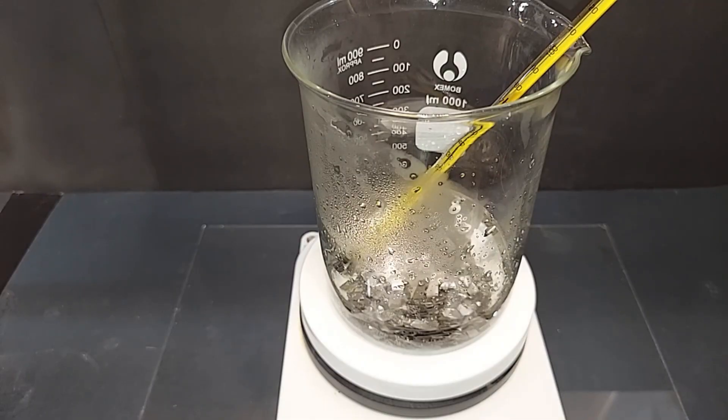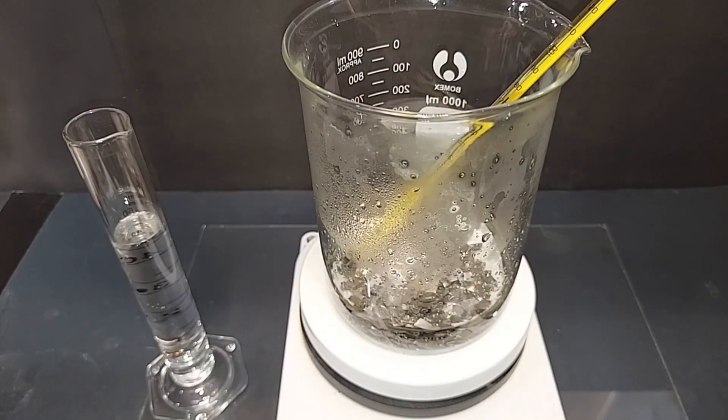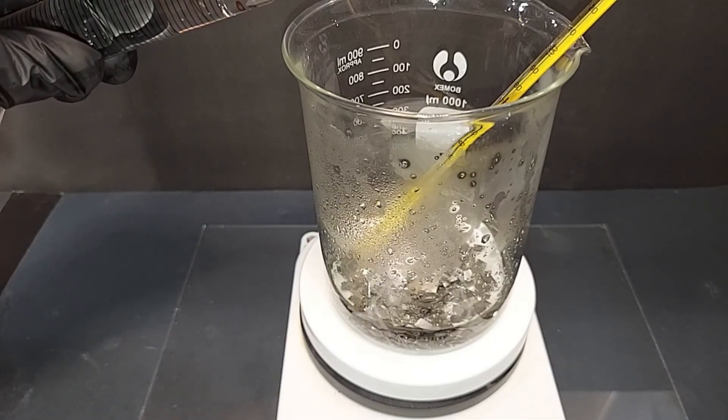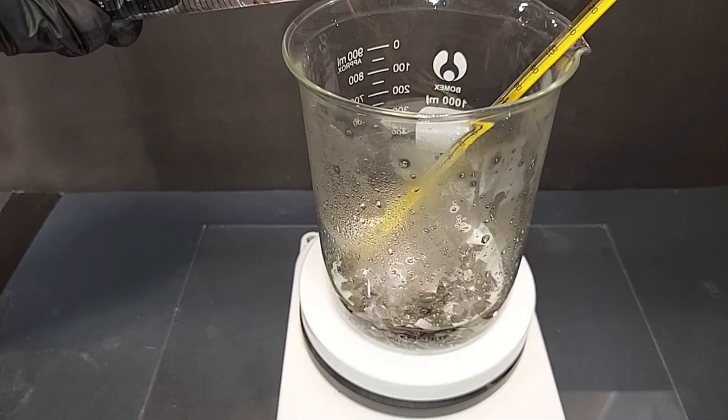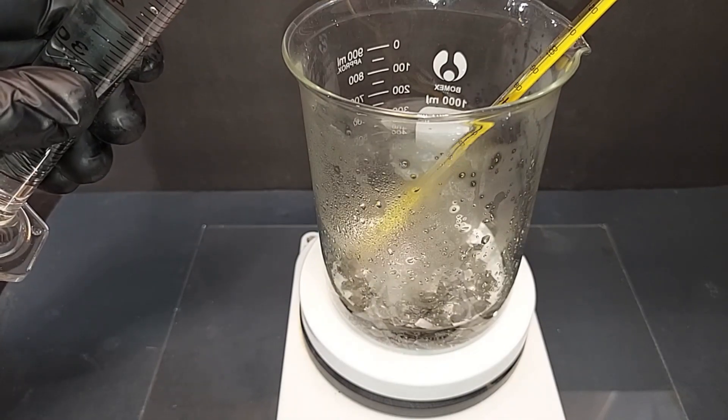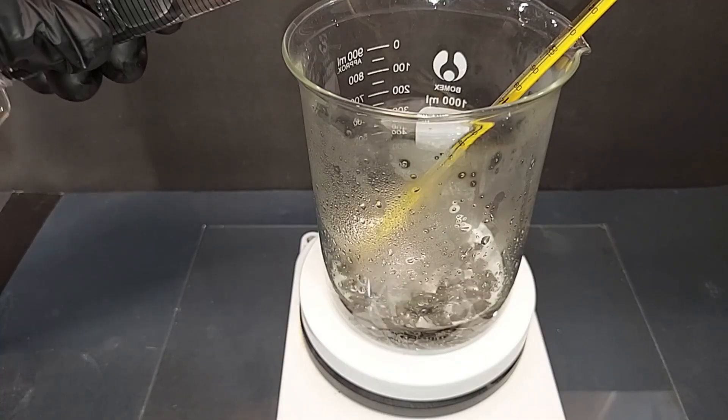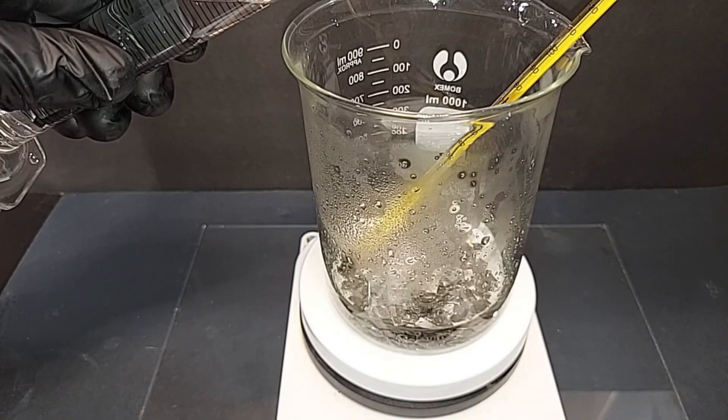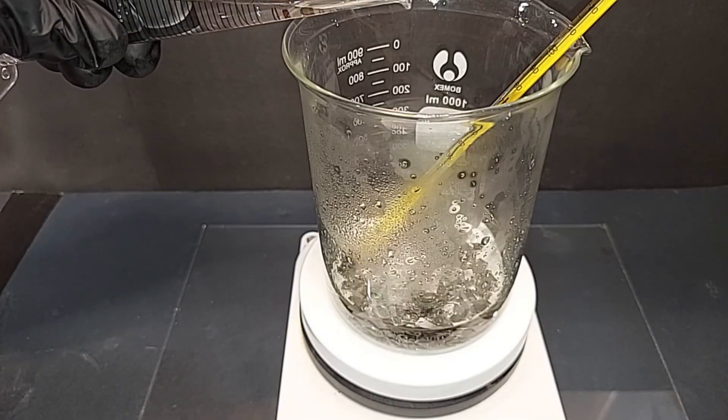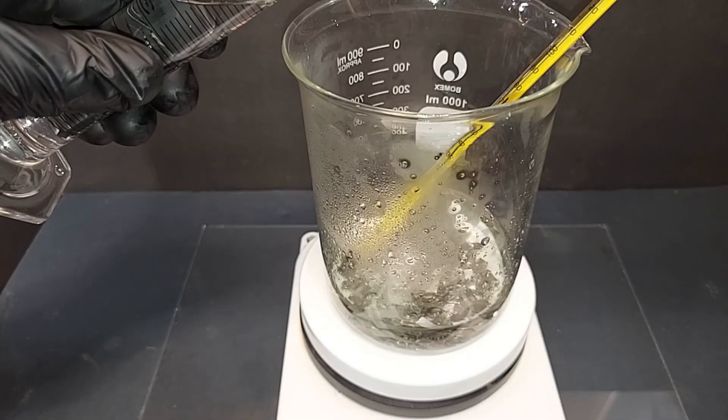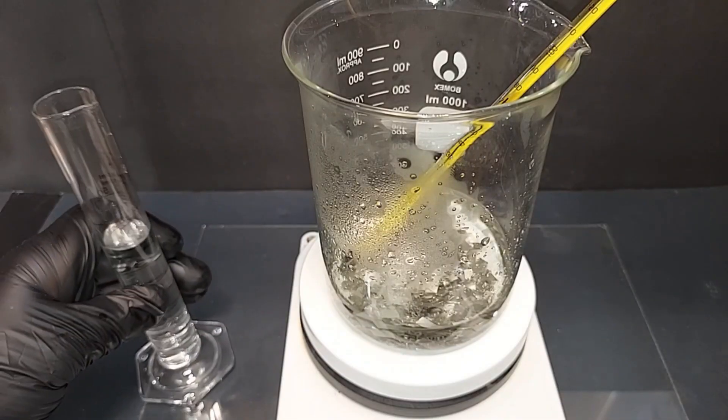I'm going to next start adding the hydrogen peroxide. I let it cool down from 75 to 70 degrees Celsius, probably not a big deal but I like keeping it around 70 when I'm adding hydrogen peroxide. This is 30%, so we should expect some reaction and this is also exothermic. I don't know if you can see it or not but there's certainly more bubbles being formed - hydrogen down there - as the passivity layer is kind of ripped away with the hydrogen peroxide. I'm going to keep adding this slowly.